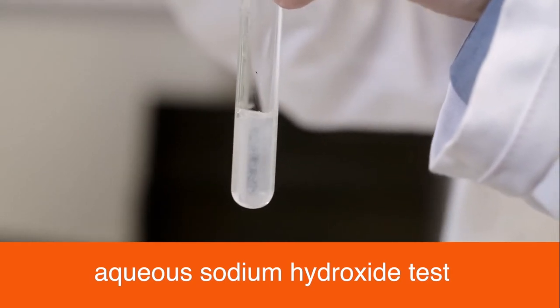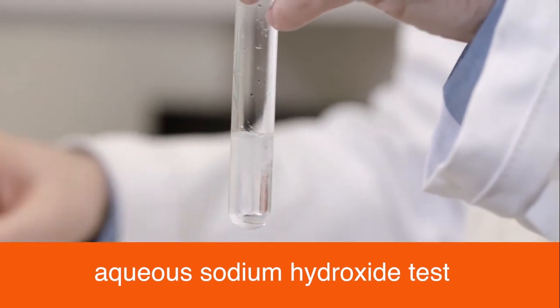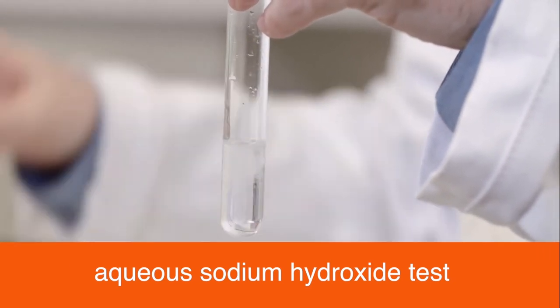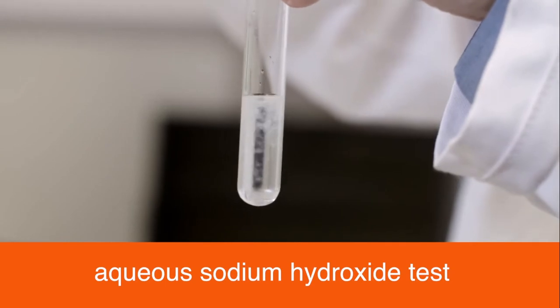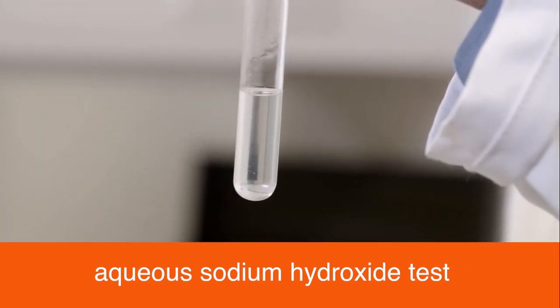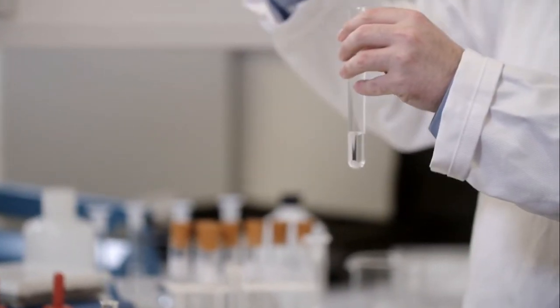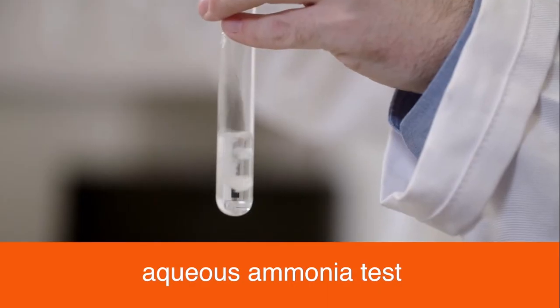A white precipitate on the addition of aqueous sodium hydroxide indicates a positive result for aluminium. The precipitate dissolves when an excess of sodium hydroxide is added. A white precipitate is also observed on the addition of aqueous ammonia. The precipitate is insoluble in excess.